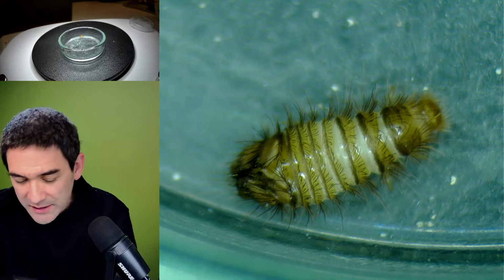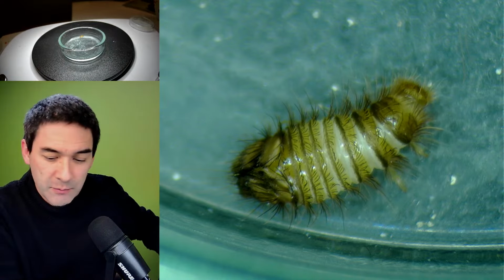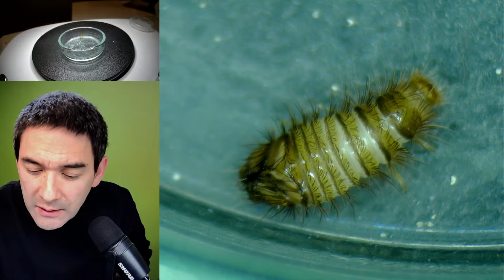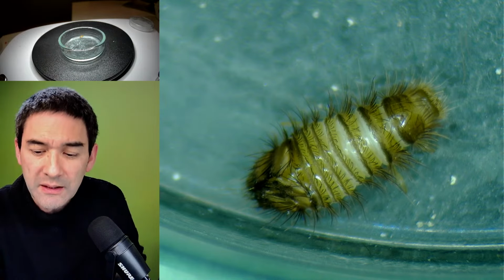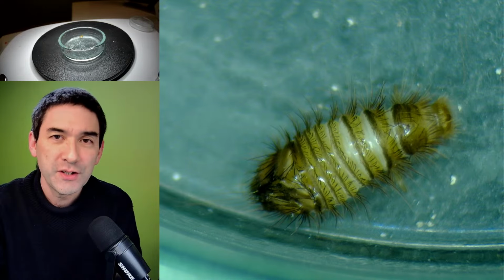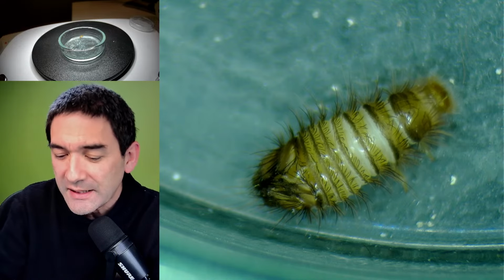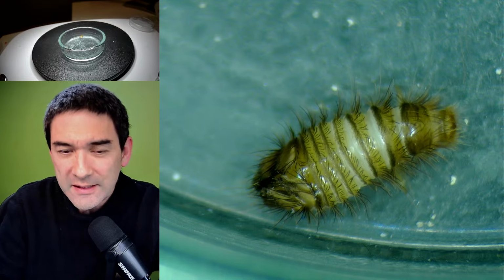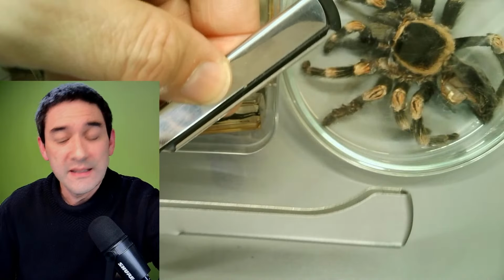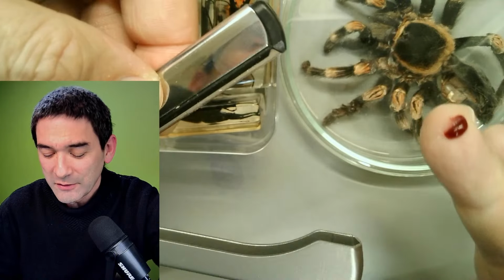And what I'm gonna do now is, before I actually show you the spider and some of the other insects and the whereabouts and everything, I'm just gonna show you what I have done, and I'm gonna feed it again. But yeah, I'm just gonna do the same thing now that, oh, great. I just cut myself. You see, you always have to be careful with sharp blades. Look, this is the thing. Yeah, I'm just gonna show this to you. This is the blade, and this is the result. You always have to be careful.